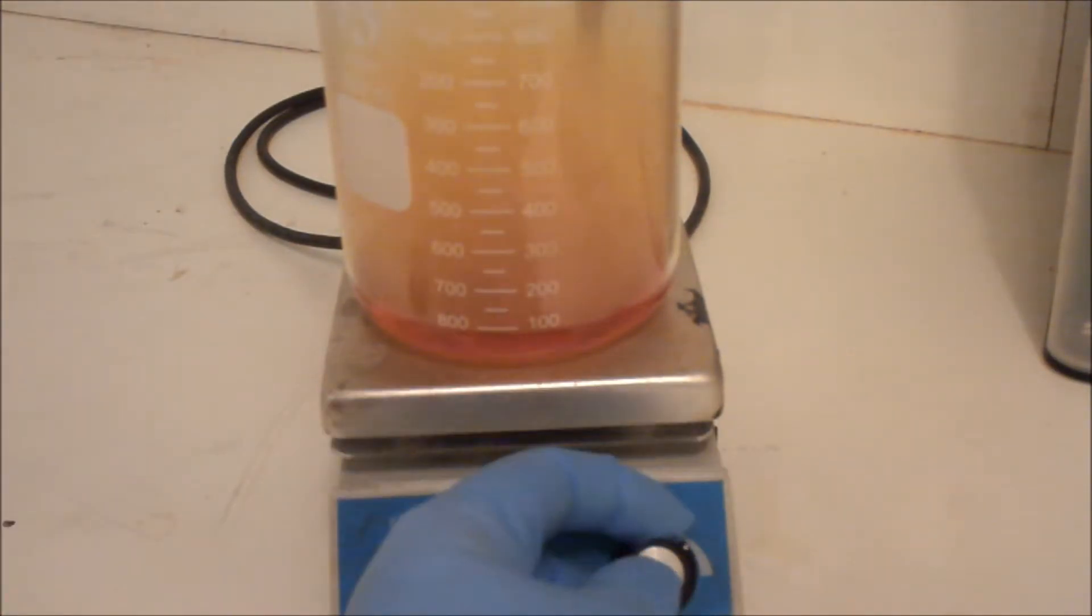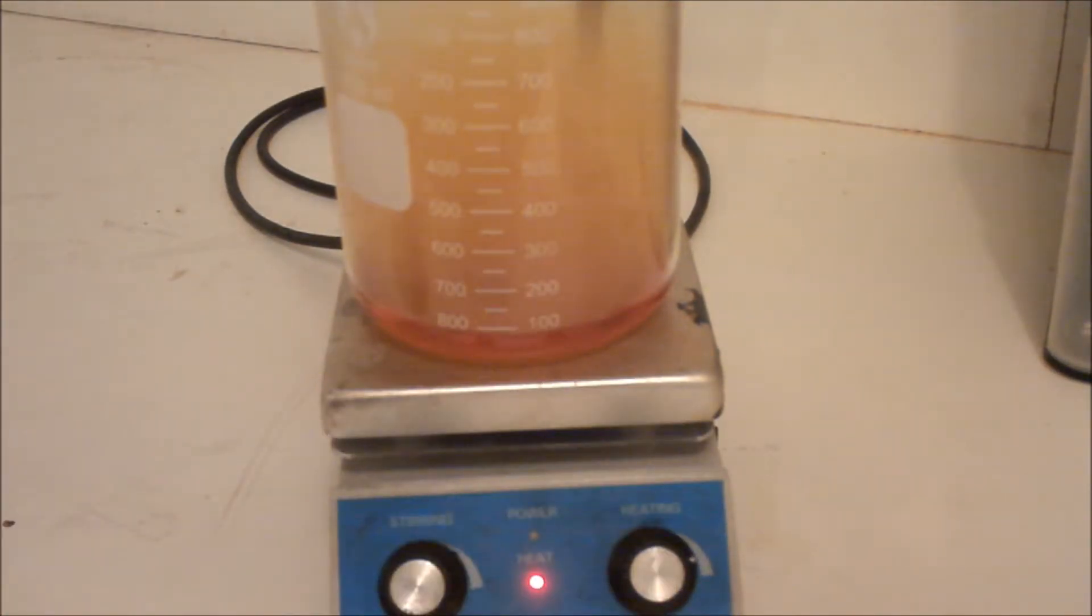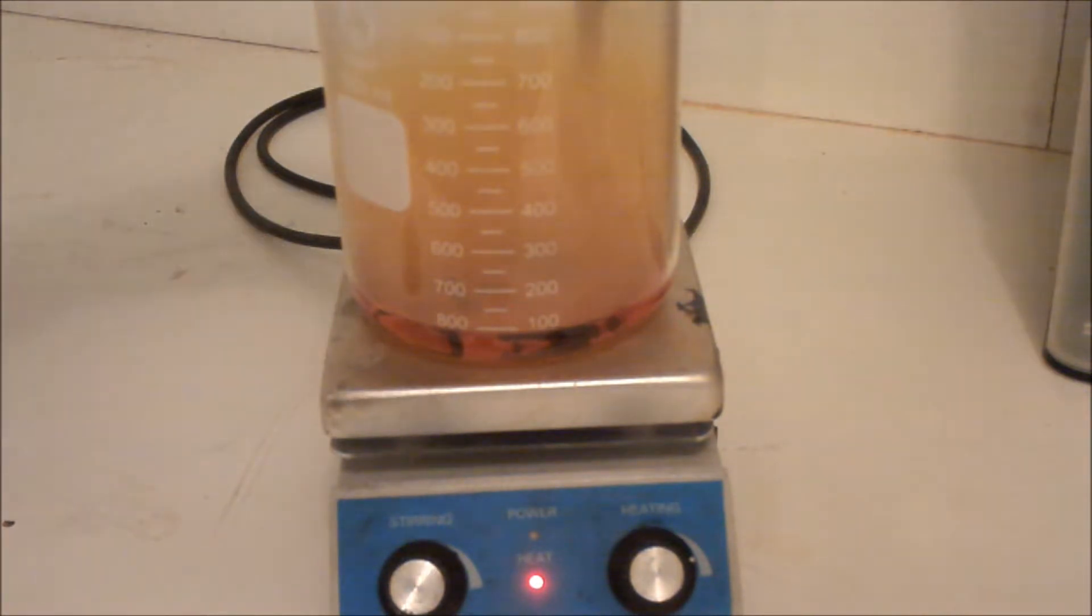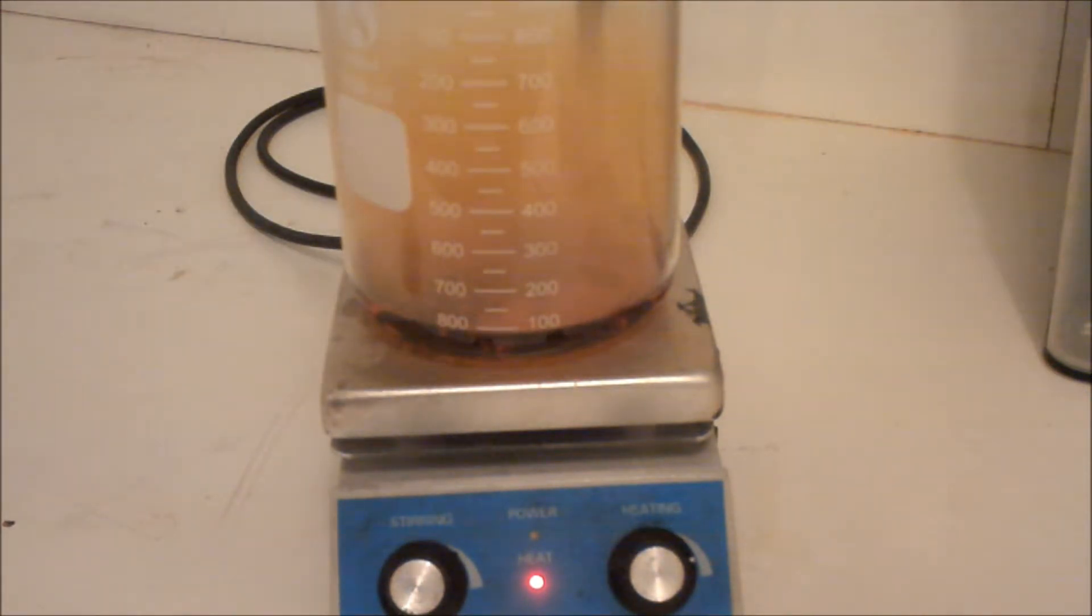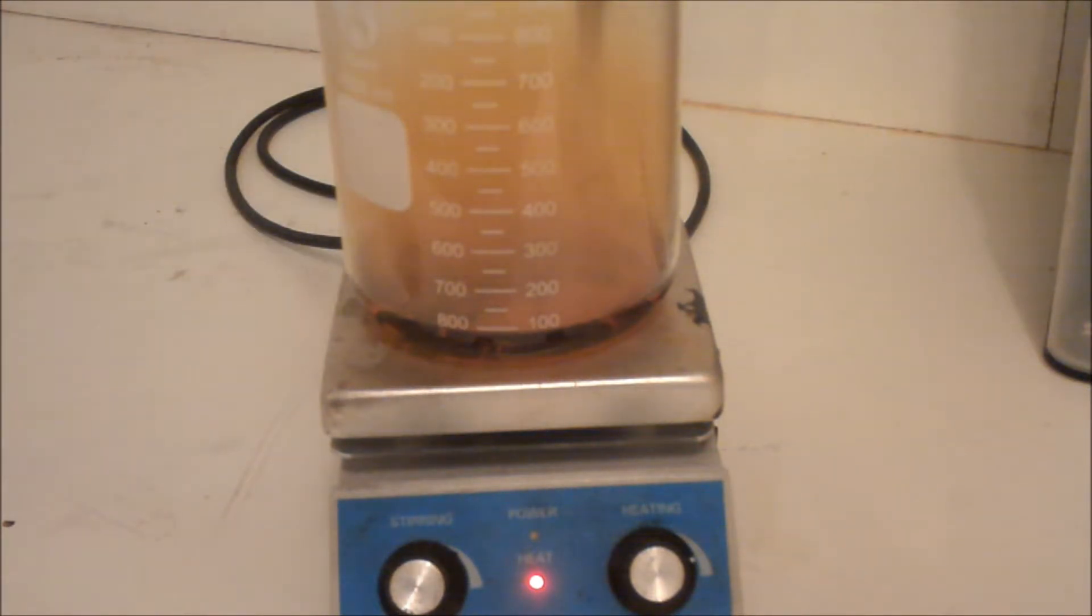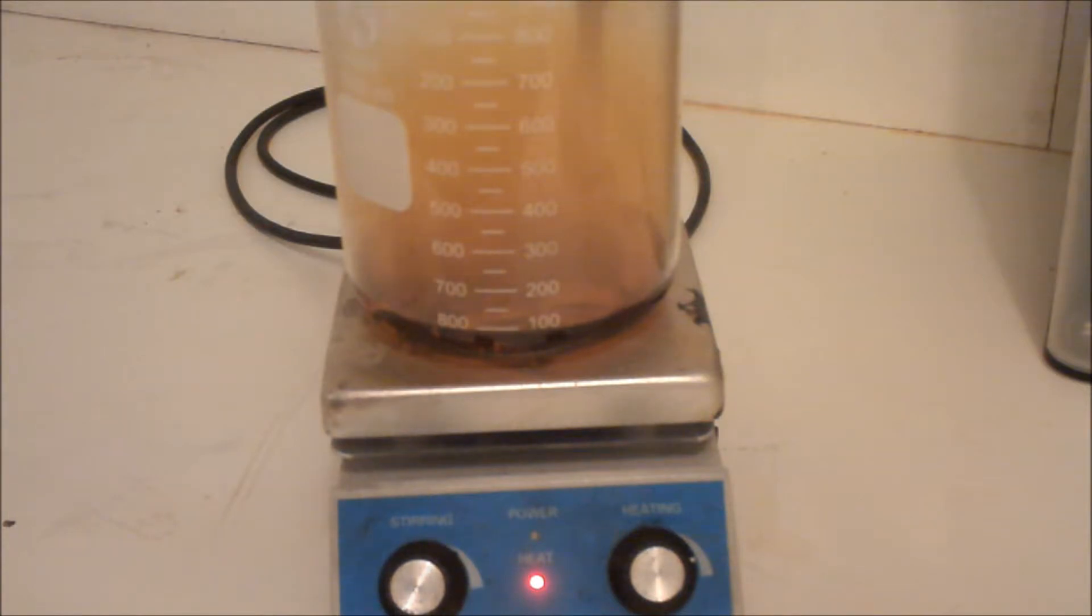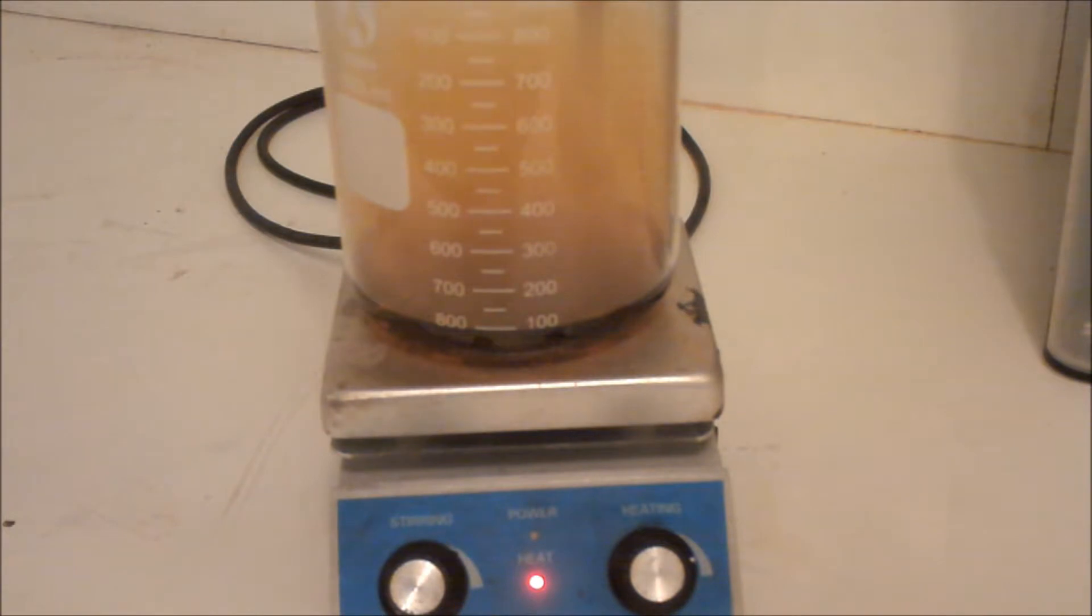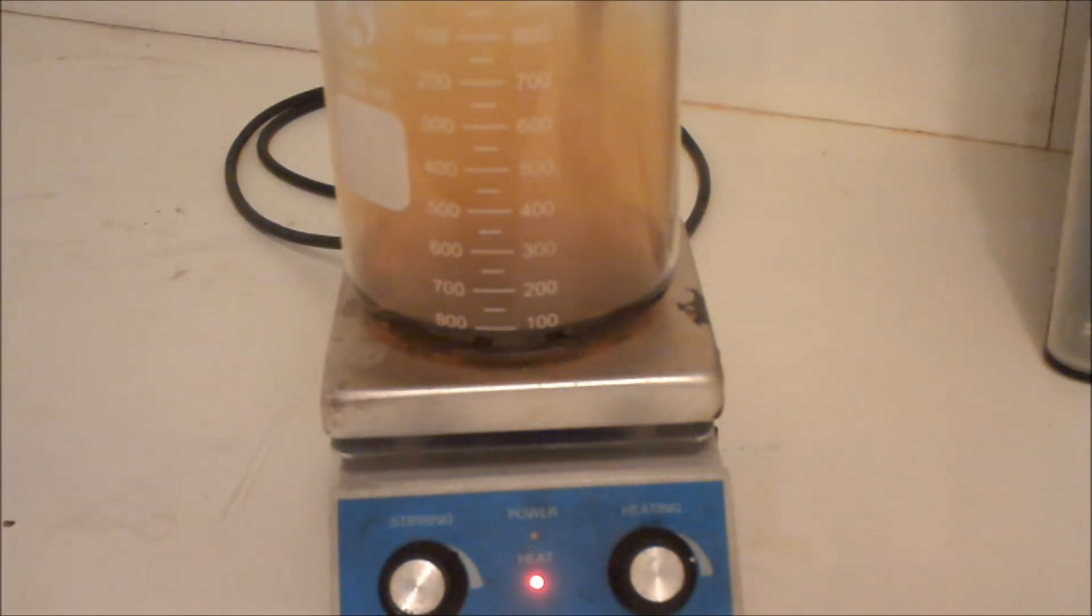Then you're going to turn on the heating and add your lead to the nitric acid. My lead has a pretty thick layer of oxidation on it, but nitric acid should be able to break through it. It doesn't matter exactly how much lead you put in. I like to use as much as I can to get the maximum yield.